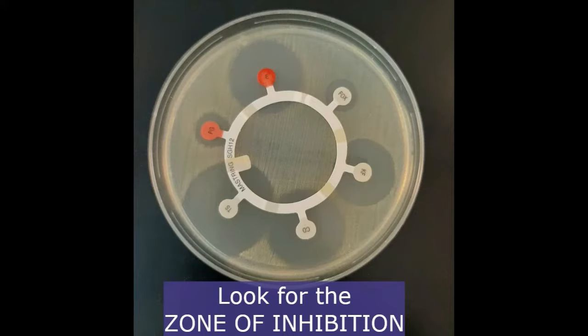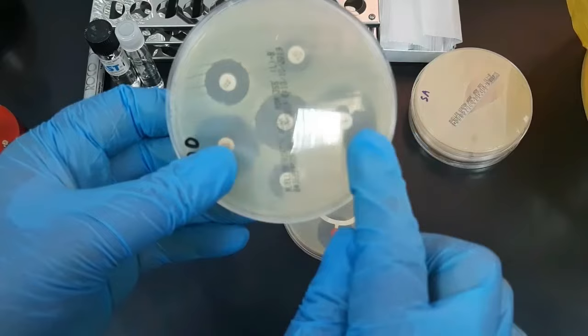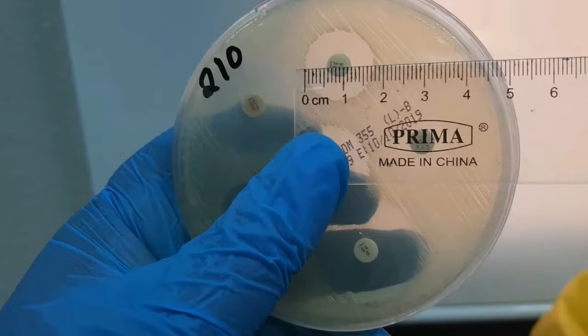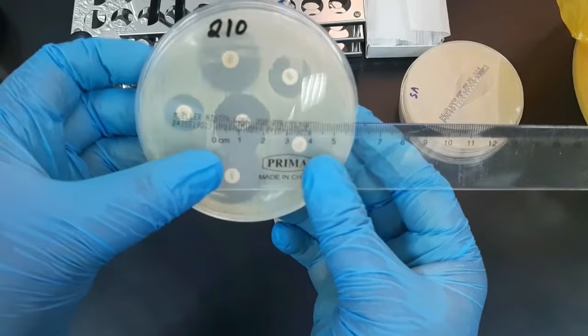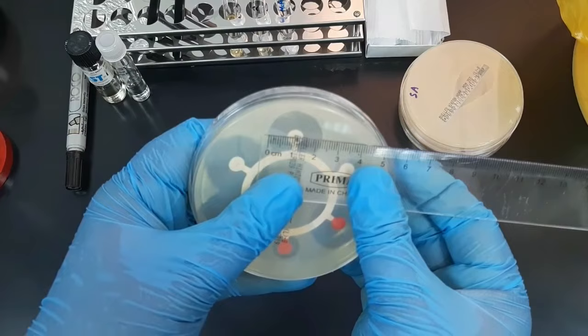Close the plate and incubate at 37 degrees Celsius in an inverted position overnight. Following incubation, the plate is taken out and examined for zones of inhibition. Measure the diameter of each zone using a ruler. Now let's see how to measure the zone diameter and the size of each antimicrobial agent's zone using an interpretive chart.